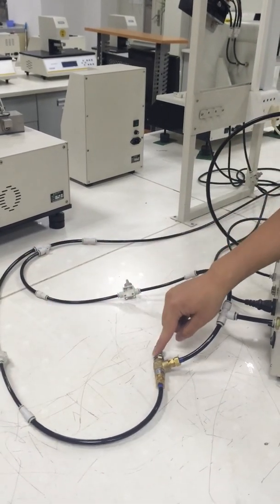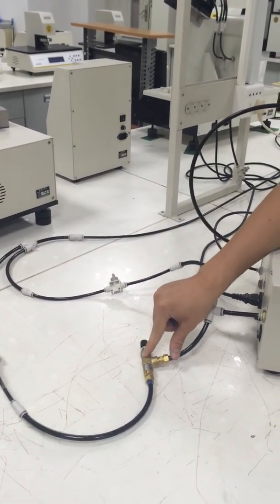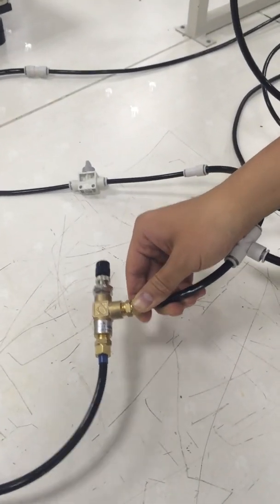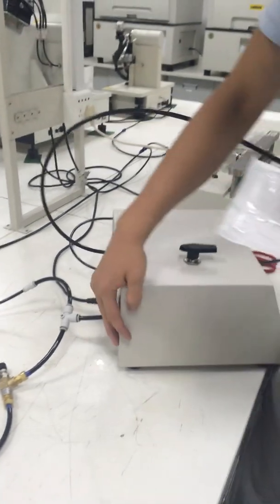Another pipe uses this flow rate control device, which is very precise. It's 200 milliliters per minute maximum.